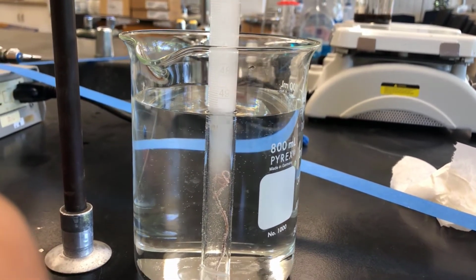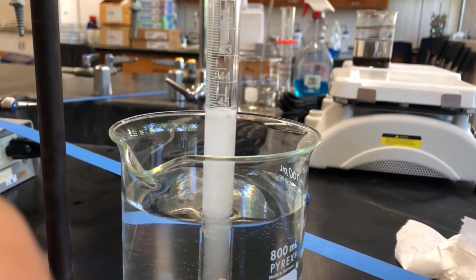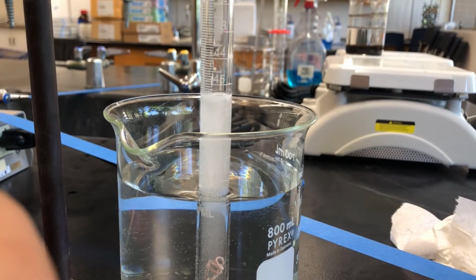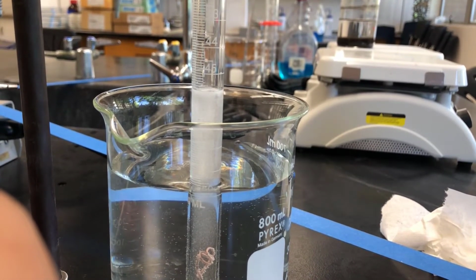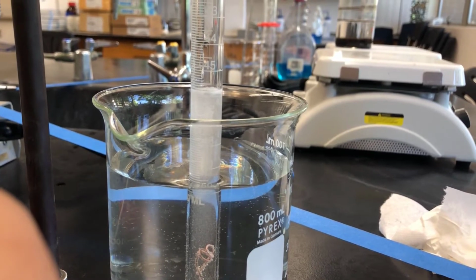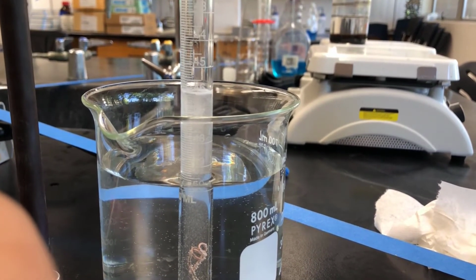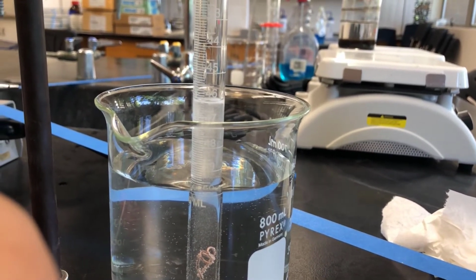So pause, we'll come back when this is all done. Oh, you see how the magnesium got away? Hopefully that doesn't affect us too much. It probably is paper thin at this point. Well, that's kind of a bummer. That is part of the experiment, so hopefully we can capture all that. We'll come back here in a minute or two and take a look at it.